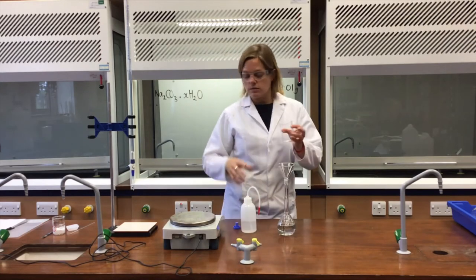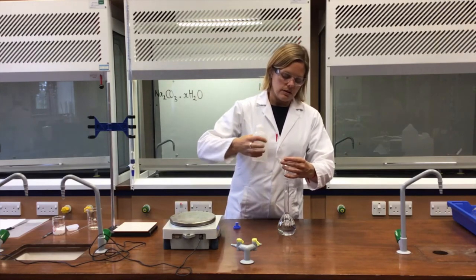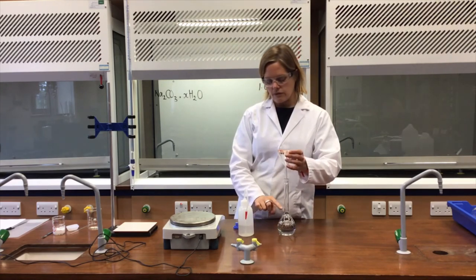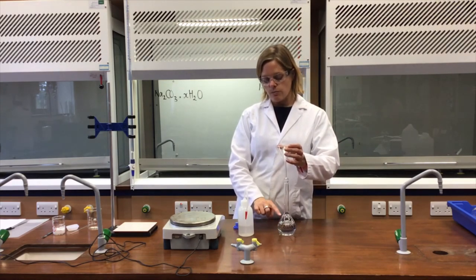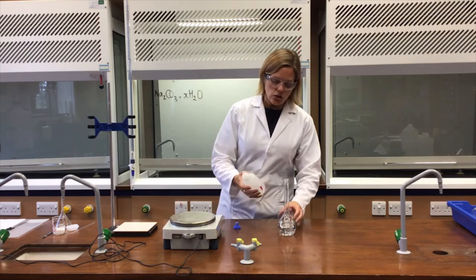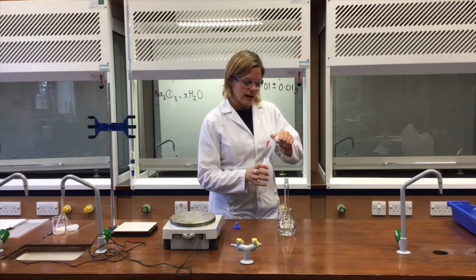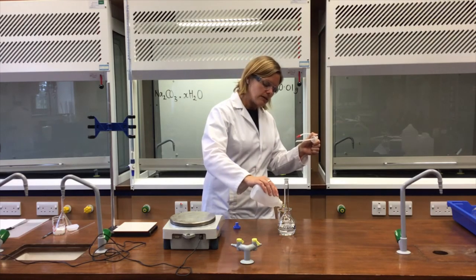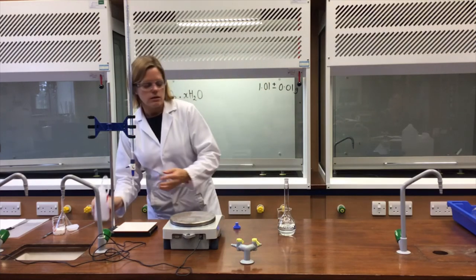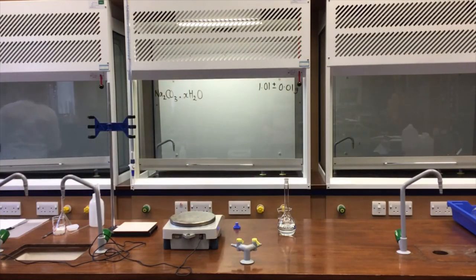The beaker gets a rinse, the stirring rod gets a rinse, and the funnel surface gets a rinse — all rinsings going into the flask. While doing this I keep a close eye on the solution level; I don't want to overshoot the mark and have to start over. To top it up, I use the freshly rinsed beaker, pour in some distilled water, and carefully add it until the solution is approaching but not touching the mark.